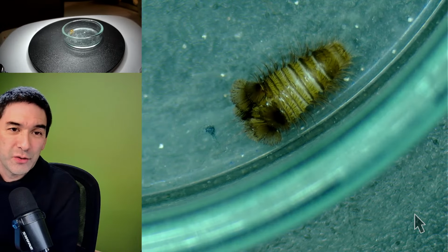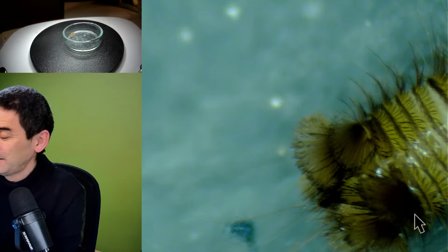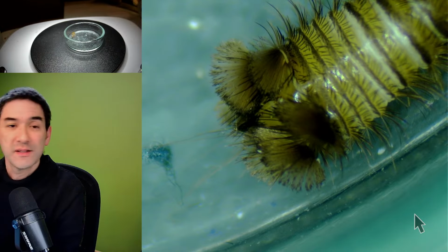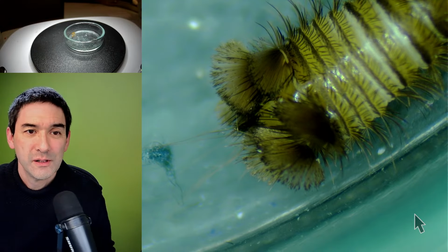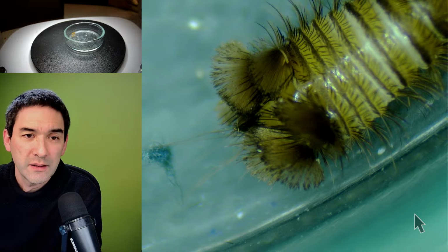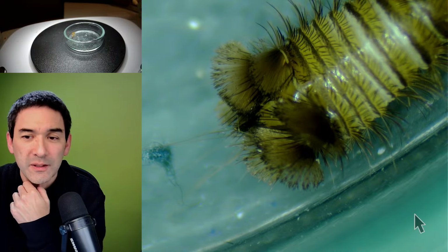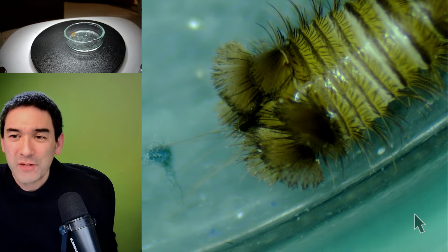These are actually those strange looking hairs, which you do not see the structure of quite well under the stereo microscope. Maybe after a minute or so, it's going to pull it back and retract again. And they seem to come off fairly easily. So they really look like some kind of defensive structures that it's able to shed off. I found this fascinating, that it responds like this.